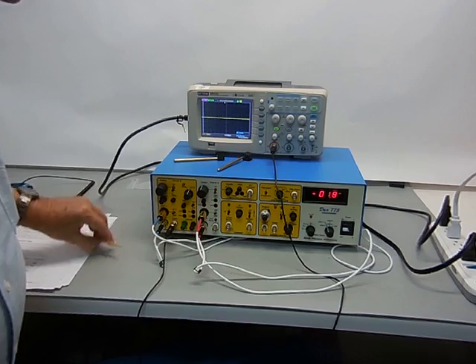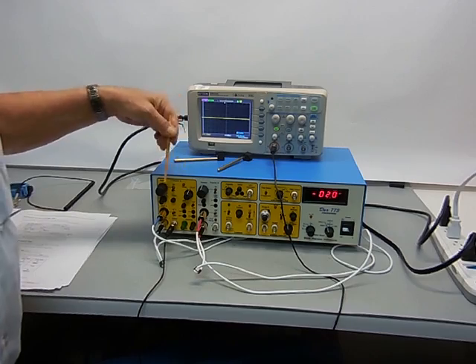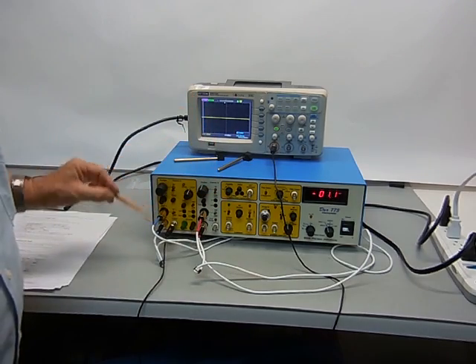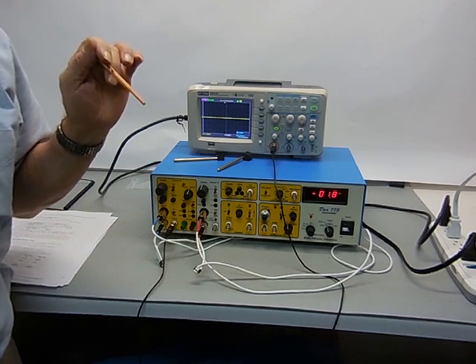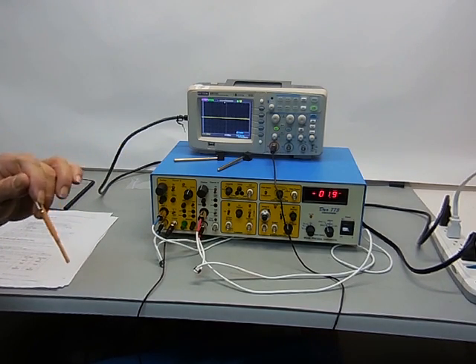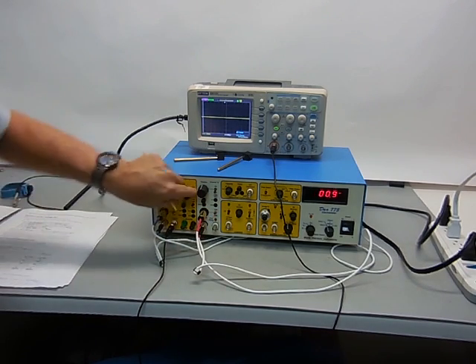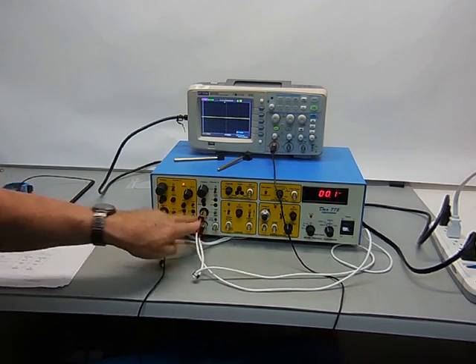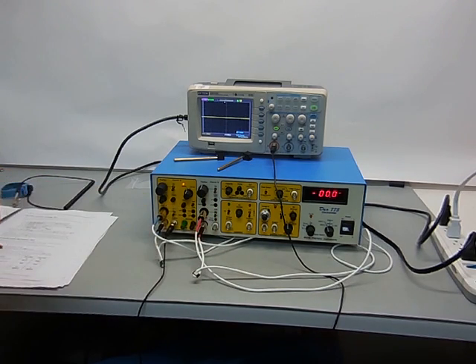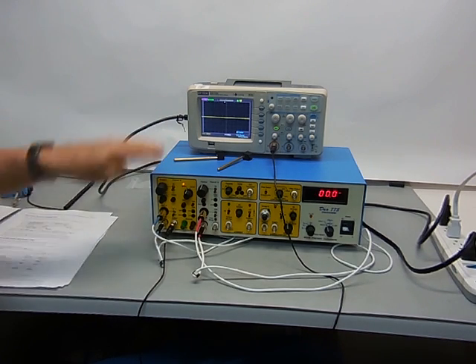That concludes the initial setup and tune-up of both the A channel and the B channel, just before you do an intracellular measurement. This has to be done every time you're using one. Whether you use the A channel or the B channel in your prep, you should always leave these plugged in. Always be in standby mode. There is no standby mode for B channel, but you can leave this in the B channel and on ground in both conditions. That's normal storage condition. It doesn't have to be plugged in, but this will protect those probes.